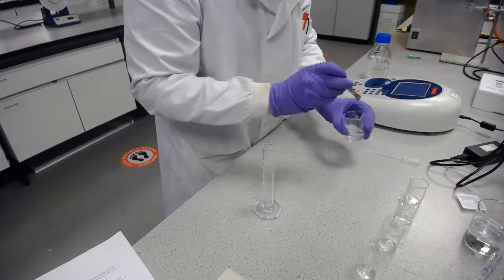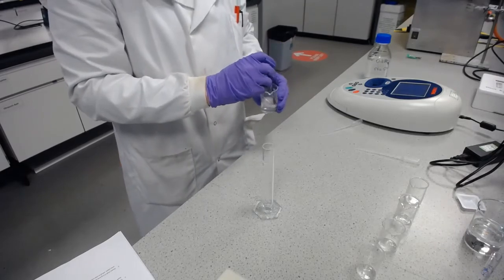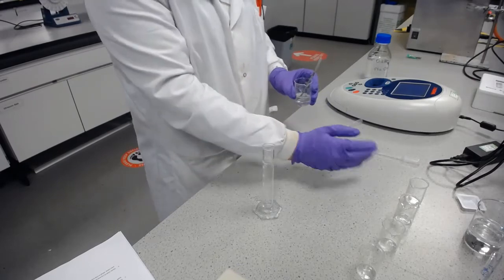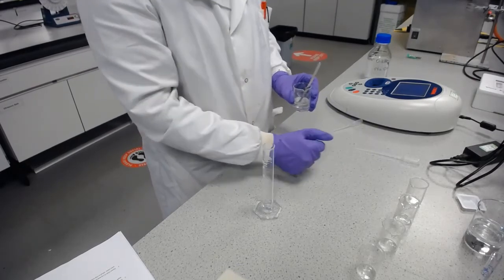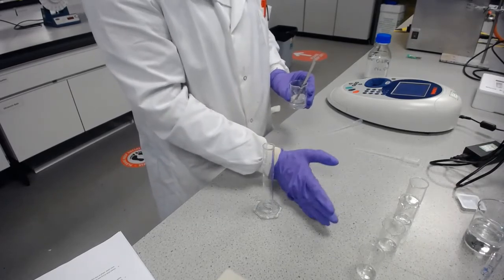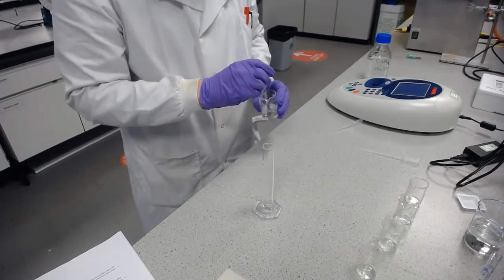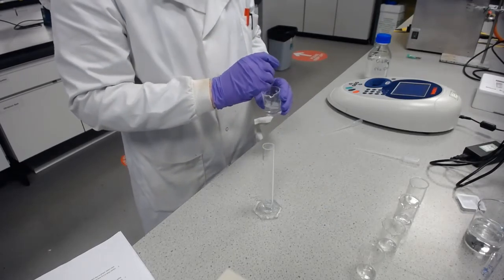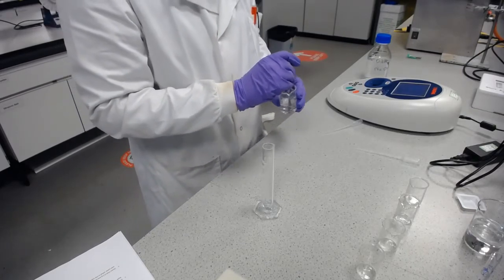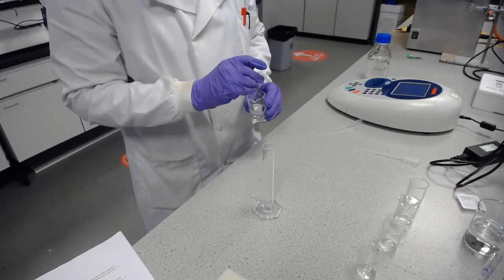And then once this has dissolved, I'll be taking 2 millilitres of this solution and diluting it with another 8 millilitres of sodium hydroxide to make solution B. Then I'll take 2 millilitres of solution B, diluting it with 8 millilitres of sodium hydroxide to make solution C. And repeat that 2 more times with C and D to make all of the different concentrations that I'll need to make a calibration curve of the absorbance of trimethoprim in sodium hydroxide 0.1 molar, so we can take an unknown and work out what the concentration is.